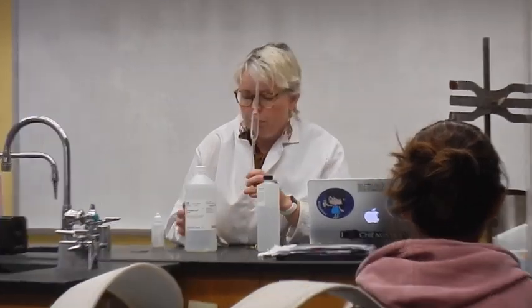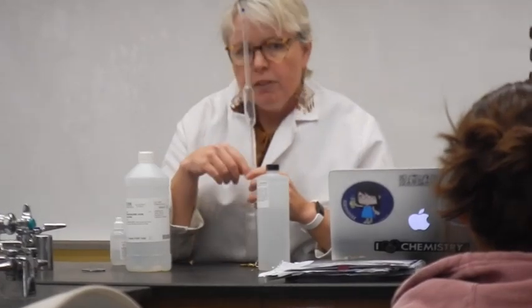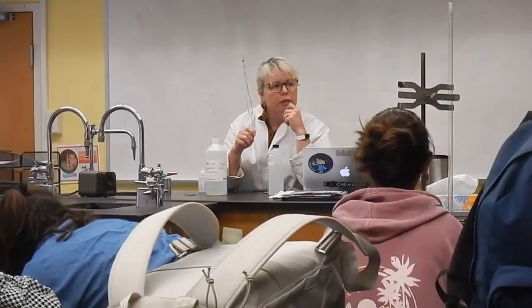Like for Section A of Paper 2, Paper 3. So what would you want to do to this? So you pour this into another beaker, your hydrochloric acid. You fill this. Is there any other precautions you want to take? You want to rinse it with distilled water.